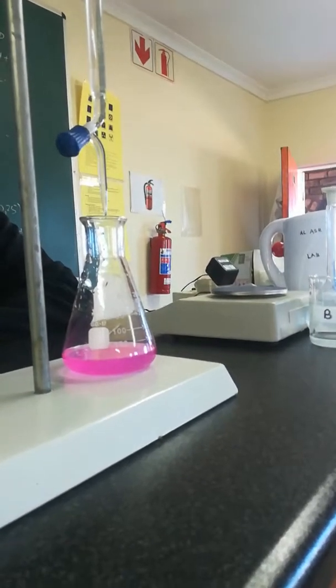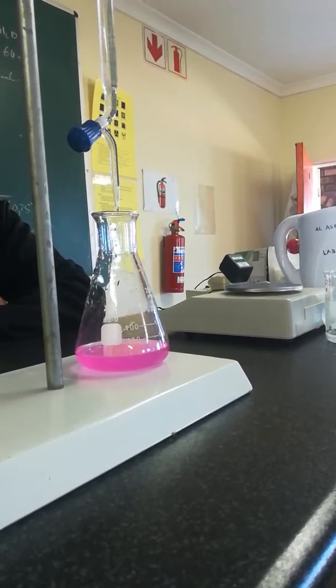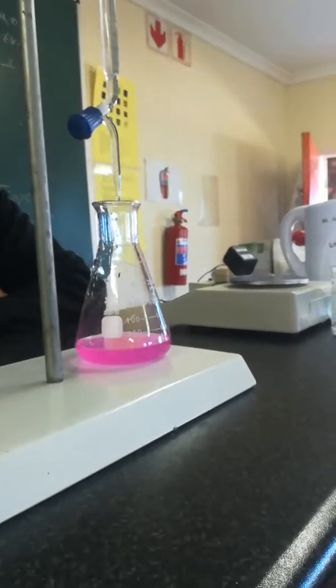Okay. So we got the volume of the base that we used, which was 17.1.